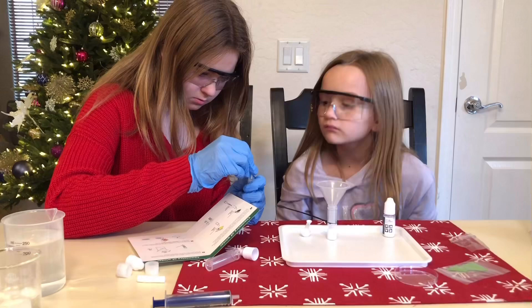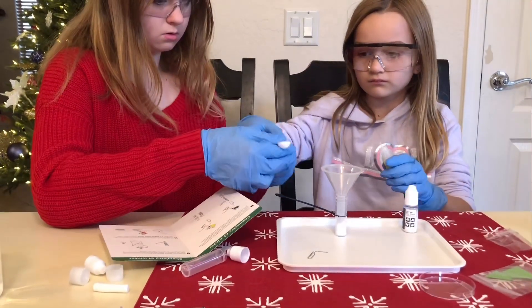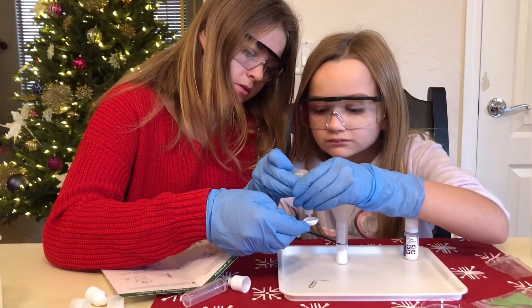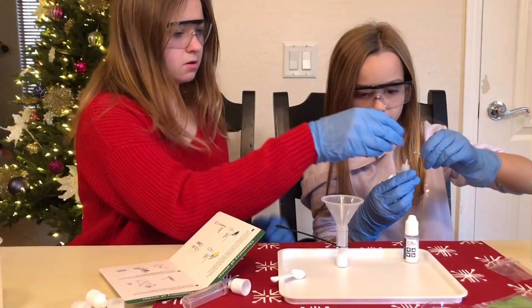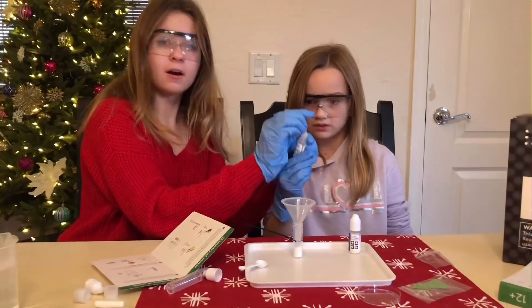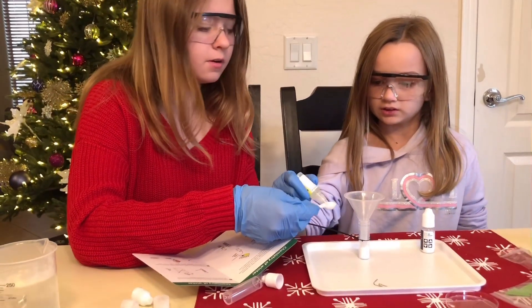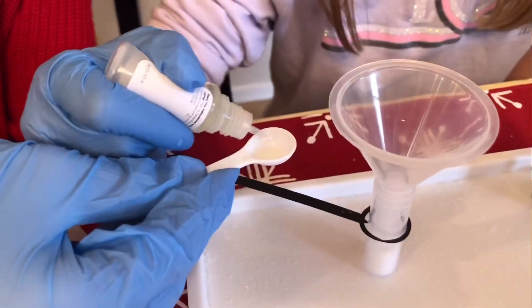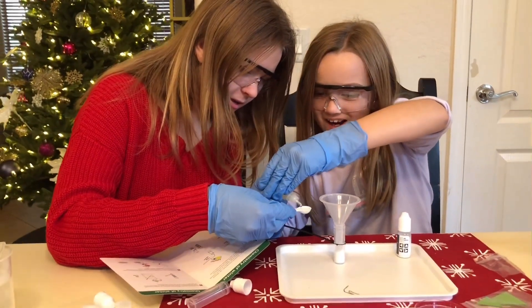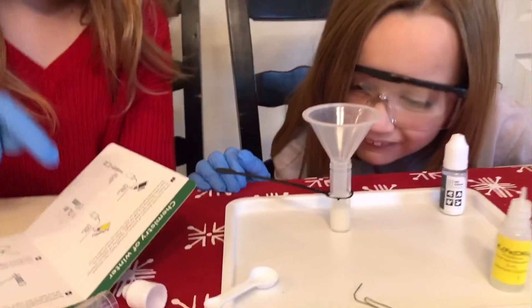Okay, there we go. Can you pour some into the spoon? One spoon. I think you gotta push that thing down — here we go. There it goes. Now we got it to work — oh, it exploded. Don't wipe it on your pants. Okay, here we go. Putting that in there — we have to fill it with some water. Fill it up the rest of the way. Okay, we'll improvise. Oopsies.